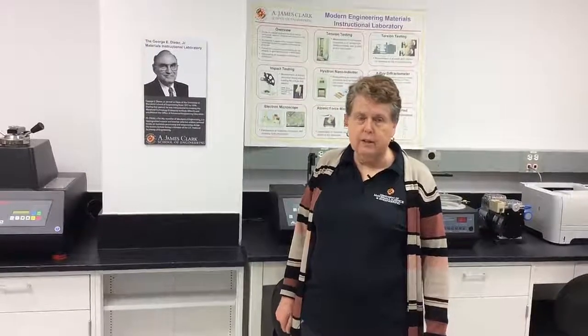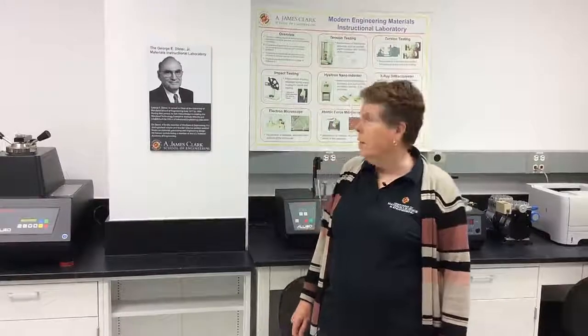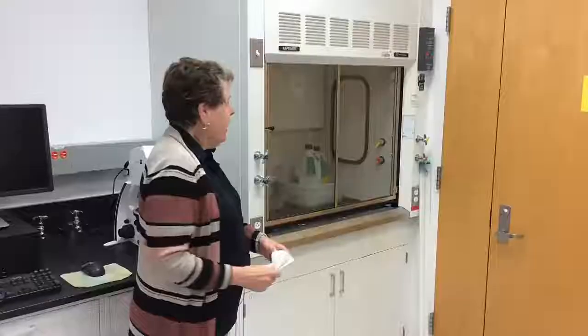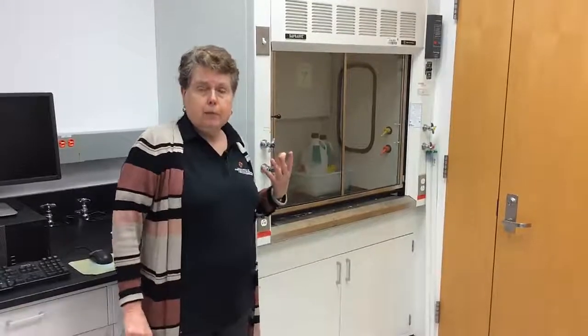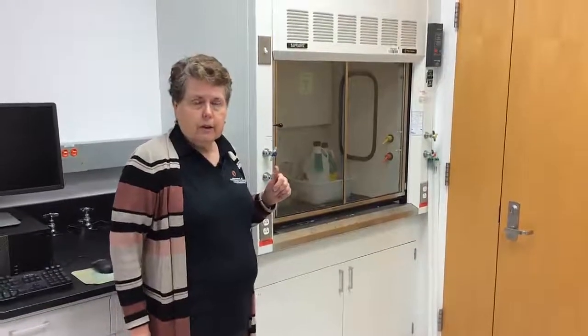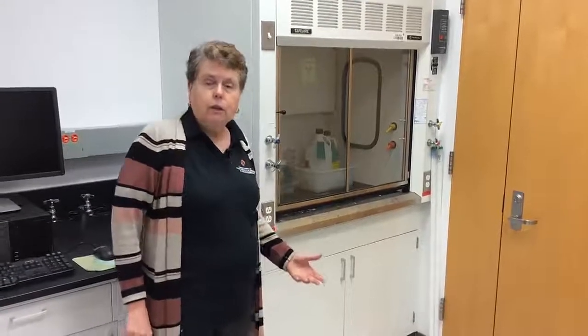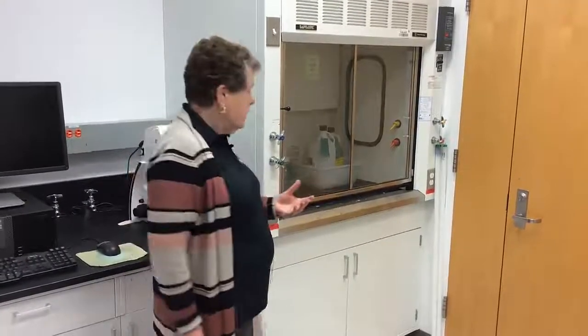I'm the Undergraduate Program Director for Materials Science and Engineering, and I'm going to give you a short video tour of our Dieter Materials Instructional Laboratory. In this laboratory, the Materials Science and Engineering Department holds their 3-credit junior level lab class where they synthesize materials.